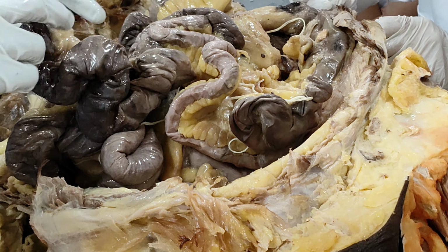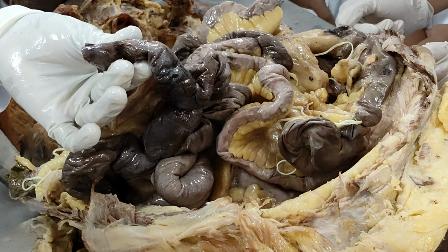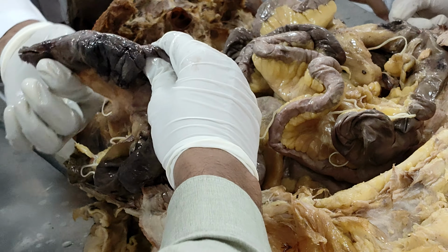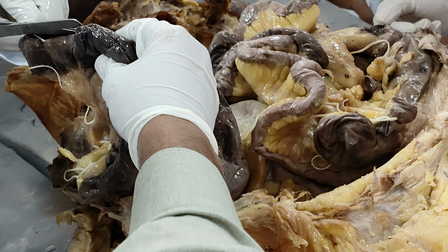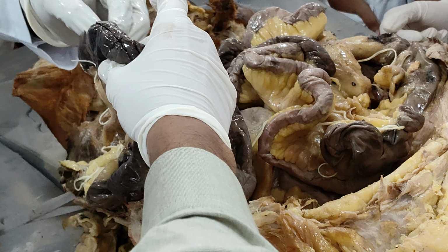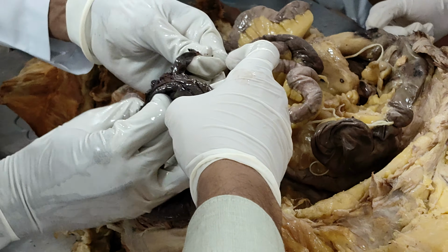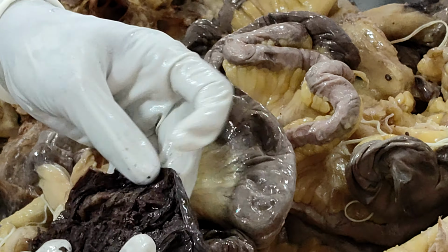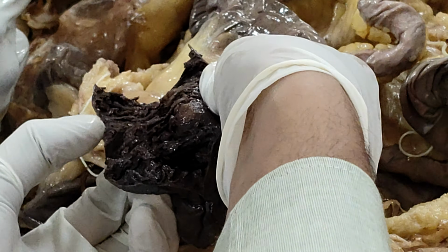I've cut the jejunum. Now I just wanted to show you an interesting feature again, the differences between the jejunum and ileum. Part one. So I'm just cutting the lumen of the jejunum. Now I just wanted to open it. Now if you open this one, see, right? I will just empty this one here and just show you. Right, hold it like this. Just give the ileum.